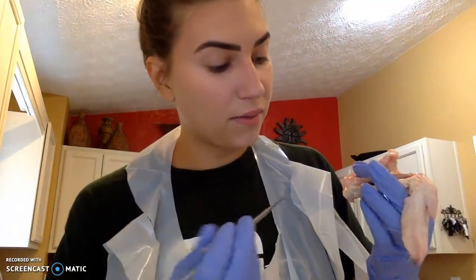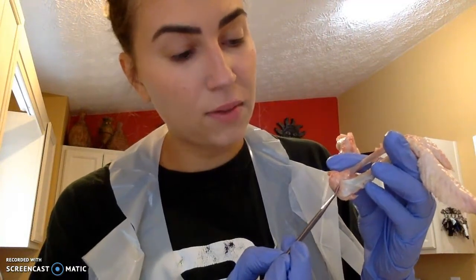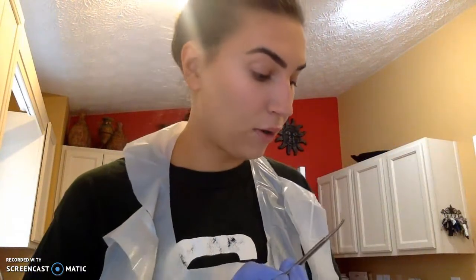To begin the actual pointing out the synovial joints, the part of this joint that's going to be continuous with the periosteum will be the articular capsule. This is what is going to help join the bones. It can be this portion right here. And to get a better view of the rest of the joints, here is a more opened dissection.